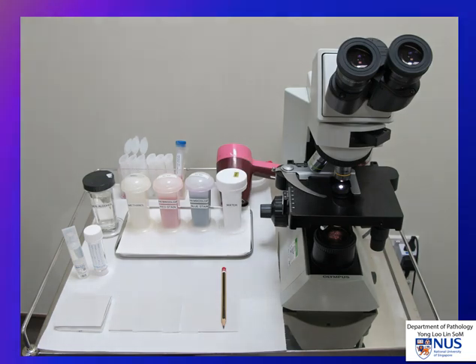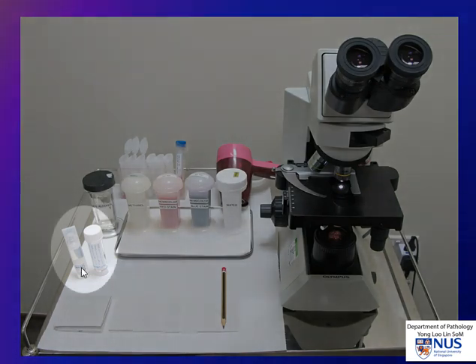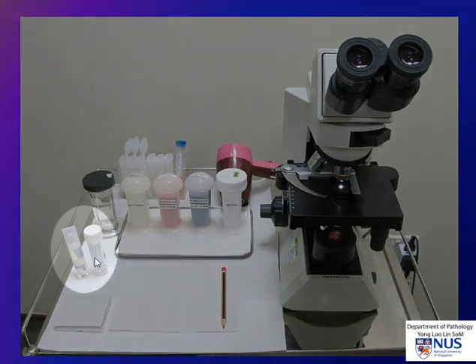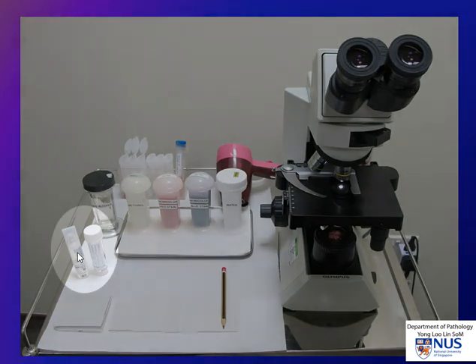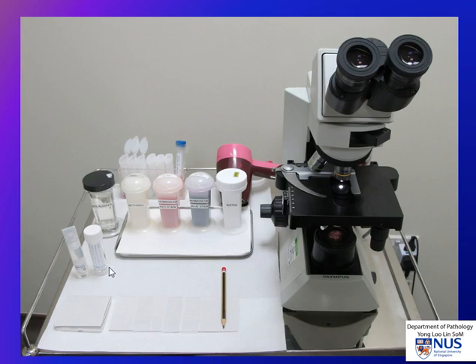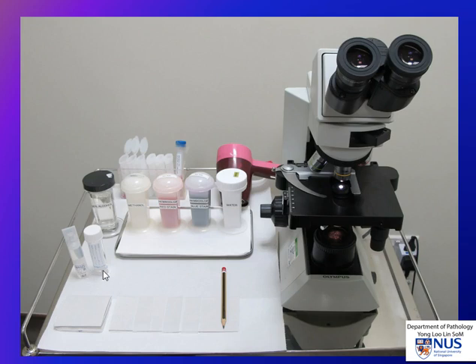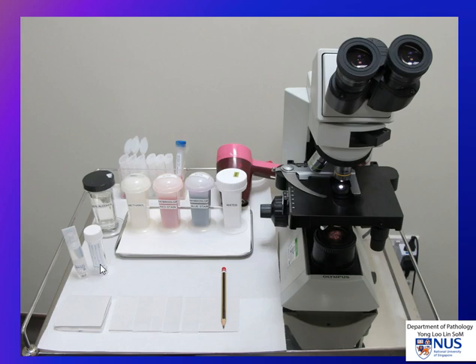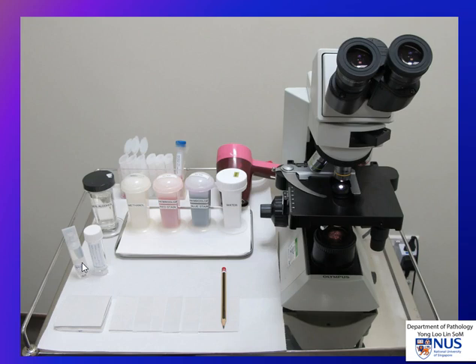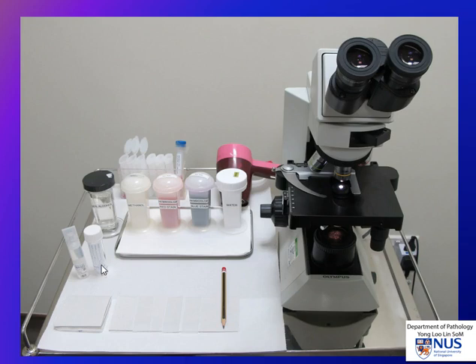We also have some specimen bottles for collection of specimens, and this is sterile saline so that we can do a needle rinse. That needle rinse can then be used for ancillary tests.